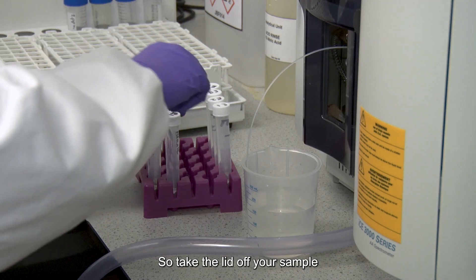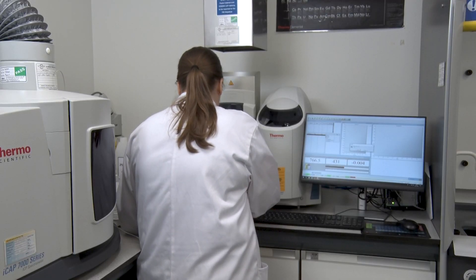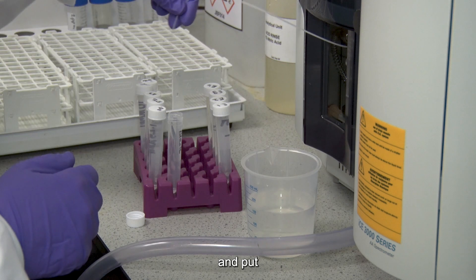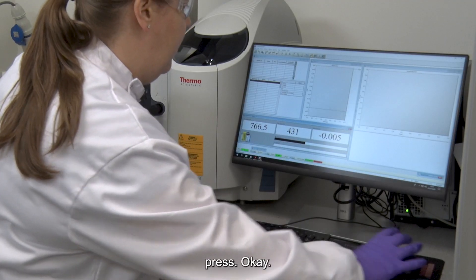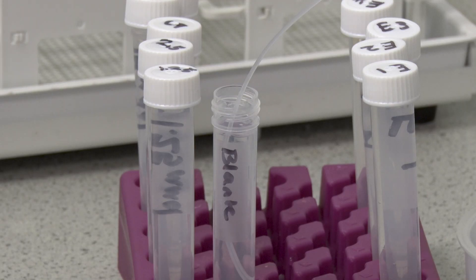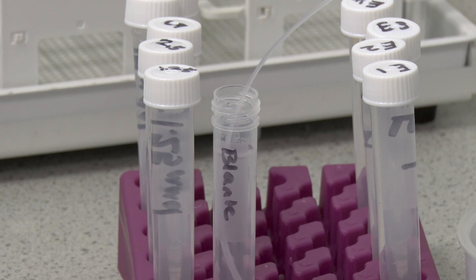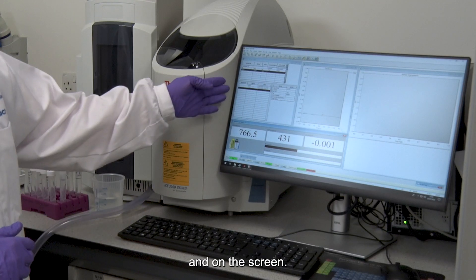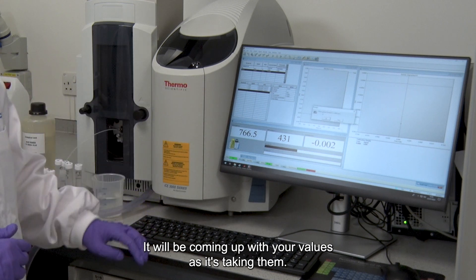Take the lid off your sample and put the tube into the sample. Press OK. It's going to collect in triplicate and on the screen it will be showing your values as it's taking them.